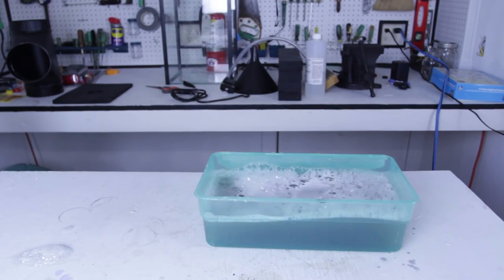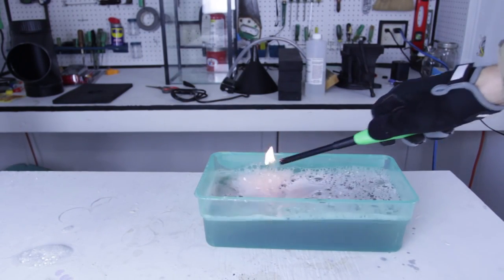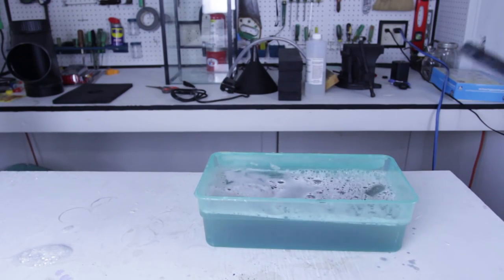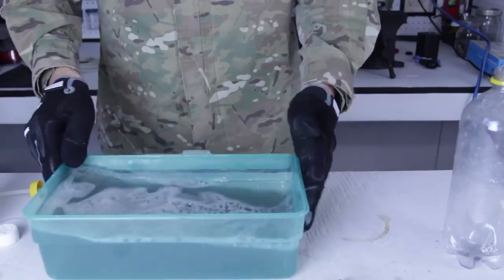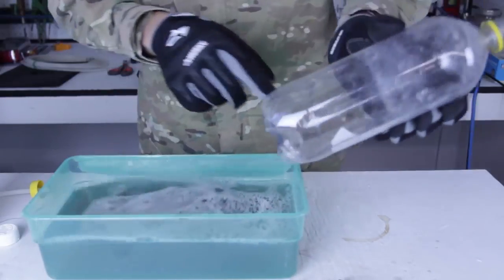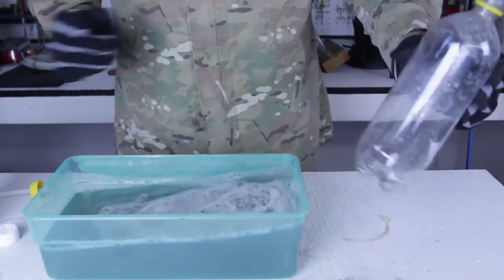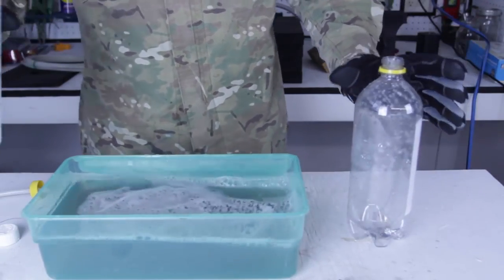Now let's try to set it on fire. Ooh, do you hear the explode? Okay, it was a little bit of fail, because I put way too much aluminum foil in there, so let's do it on a smaller scale.